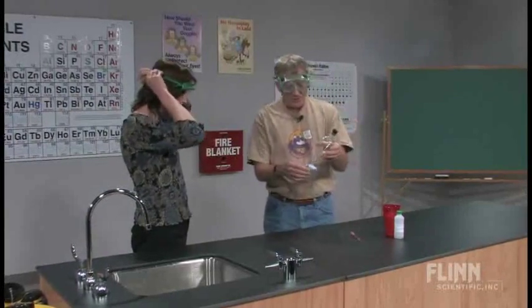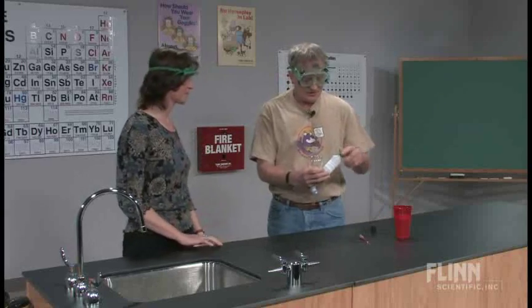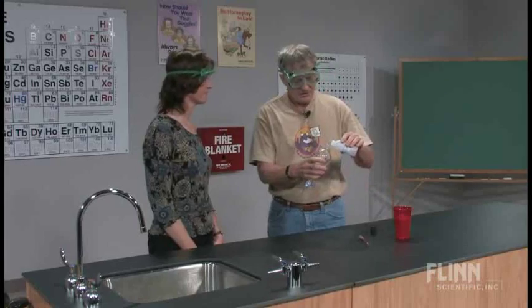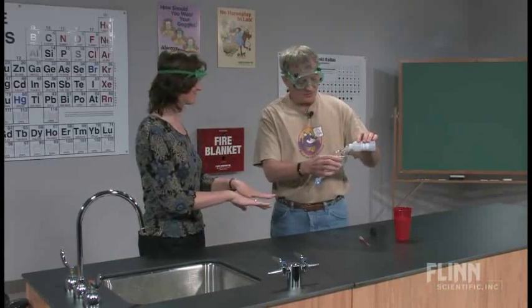You can put your goggles on, and I'll bring mine around. What I'm going to do is place a little bit of a volatile liquid, you know what a volatile liquid is, I'm sure, inside this flask. This is acetone, by the way, nail polish remover. You can put your hands behind your back. Or do you have nail polish on? No. Okay, we're in good shape.